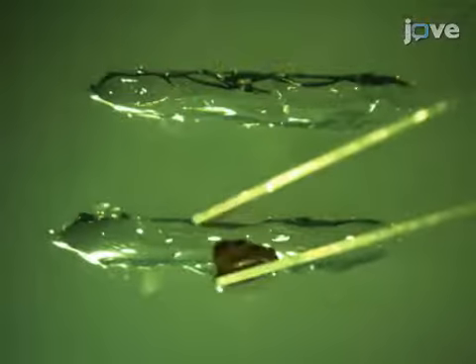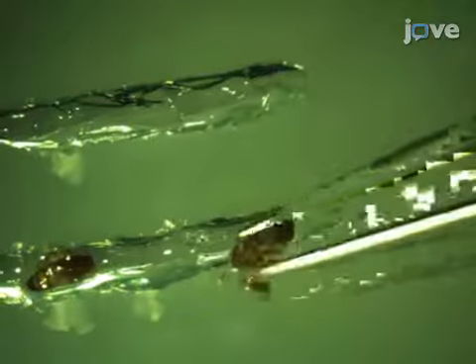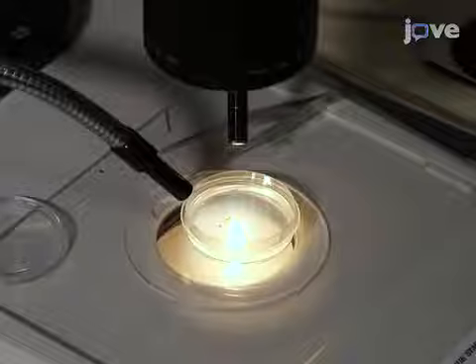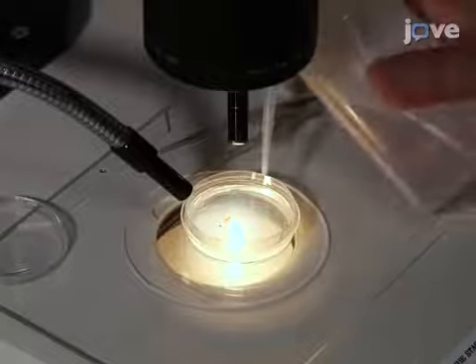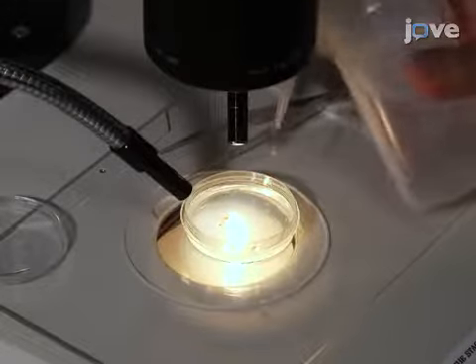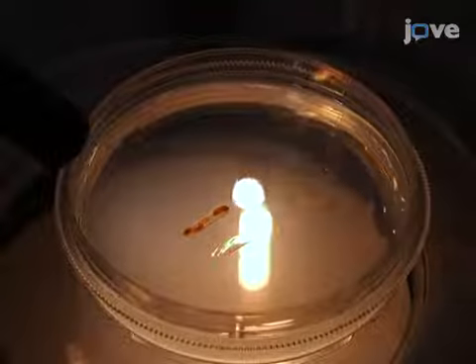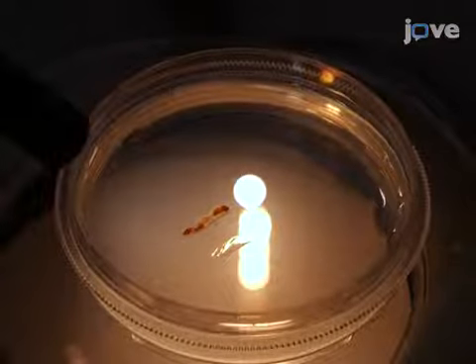Then, embed flies into the trench, with the surface for analysis sitting just above the gel surface. In this case, the dorsal side is of interest. Now, fill the dish with 70% ethanol until the flies are completely submerged. This reduces reflections off the cuticle that can obscure the pigmentation pattern.